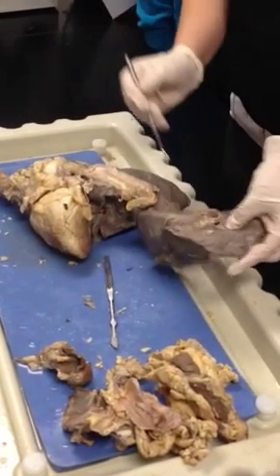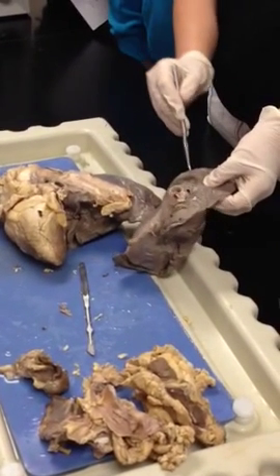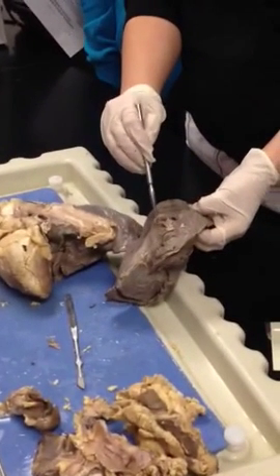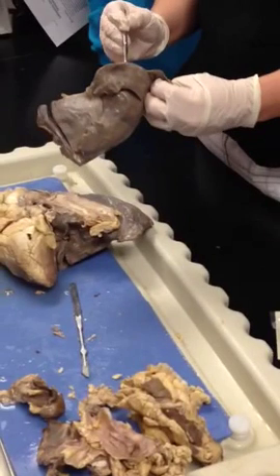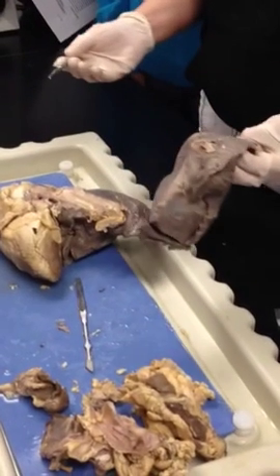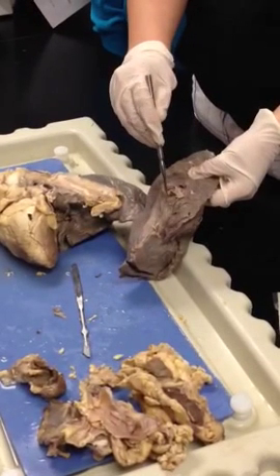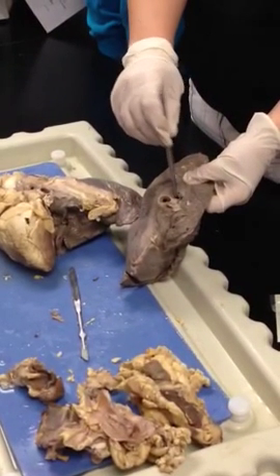All right, so you have your primary bronchi up here. Between this vessel here and this vessel here, this one has a much flimsier wall, right? Because veins do. They have much smaller tunica media. So your pulmonary vein is down here and your pulmonary artery is here.